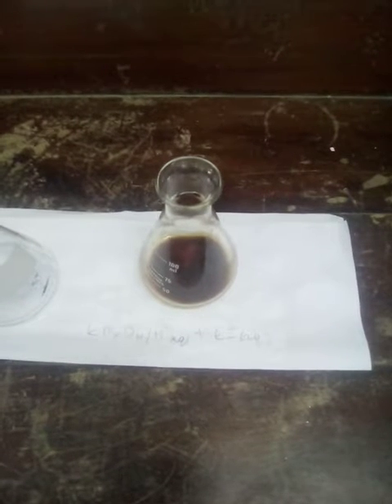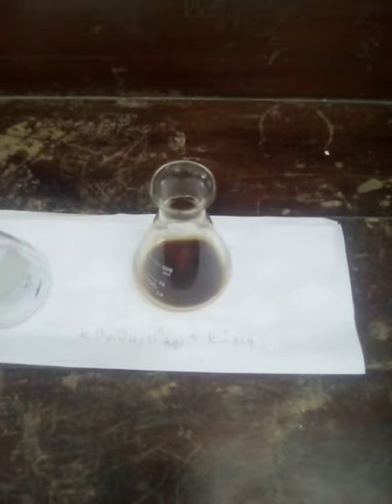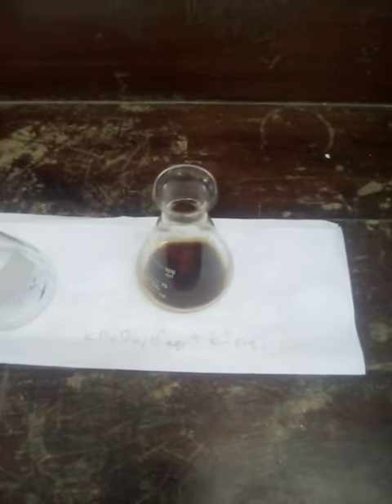Now we're going to do that by taking a sample of the mixture, pouring it into another conical flask, and we're going to add starch solution to test if iodine is present in this mixture. Alright, so we're going to take a small amount, pour it into another conical flask. We're going to swirl it a little and pour a small amount in a conical flask.